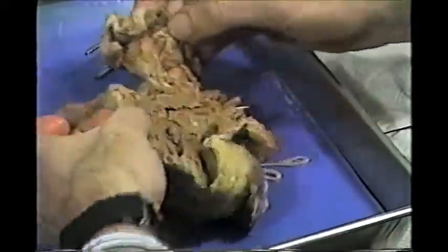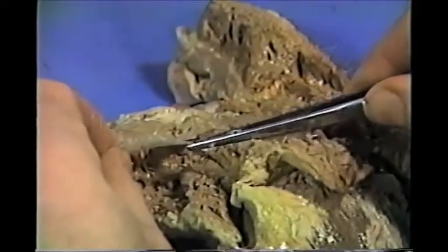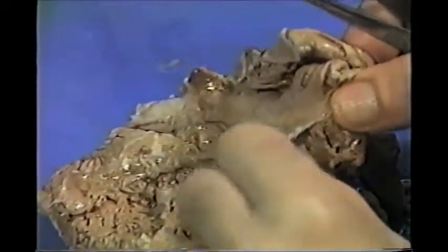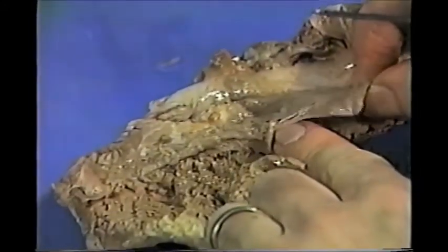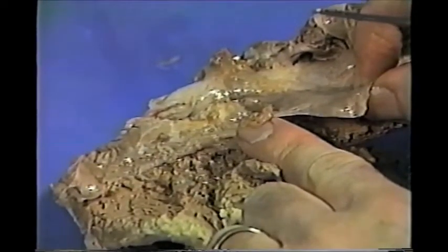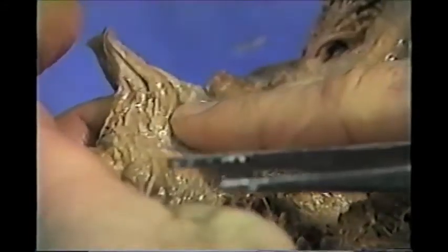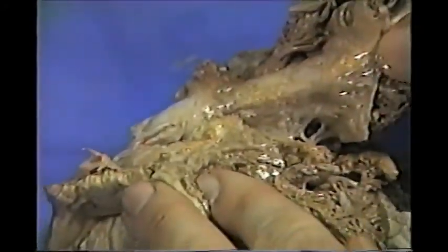Let's look at the right side. This is the right ventricle. This valve is the tricuspid valve flap; here are chordae tendinae from the tricuspid, and here's another valve flap. Notice that the valve flaps are not very big, the chordae tendinae are not that big, and here under my fingernail is part of a papillary muscle — those aren't very big. Above the tricuspid valve, this area here would be the right atrium. Remember how these valve flaps looked and how thick the right ventricle wall is.